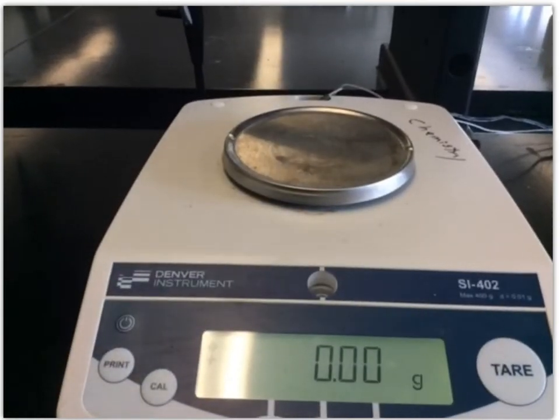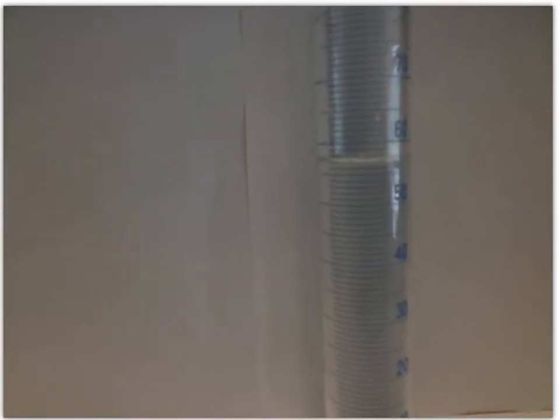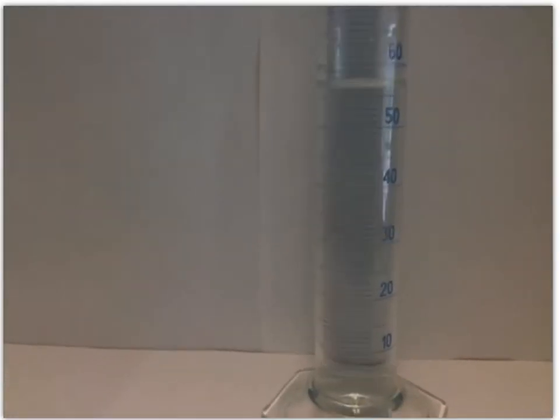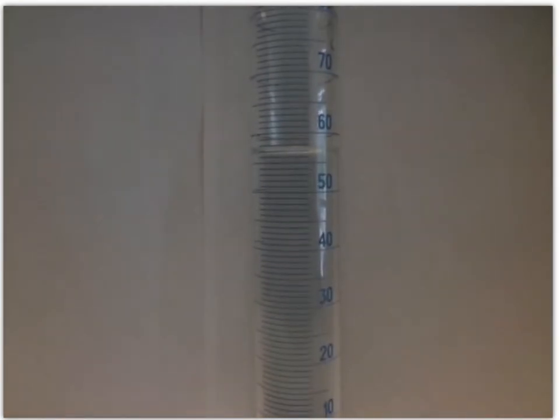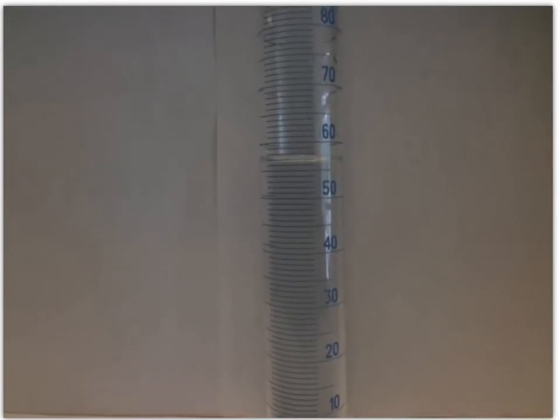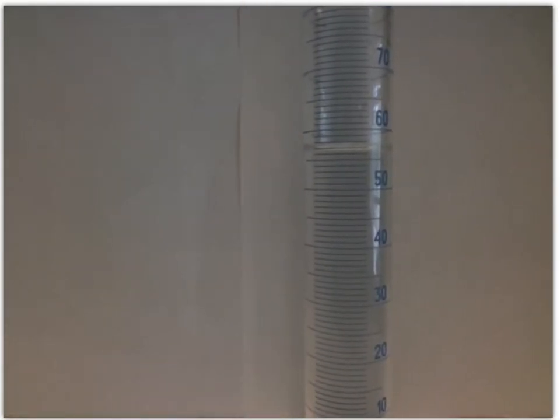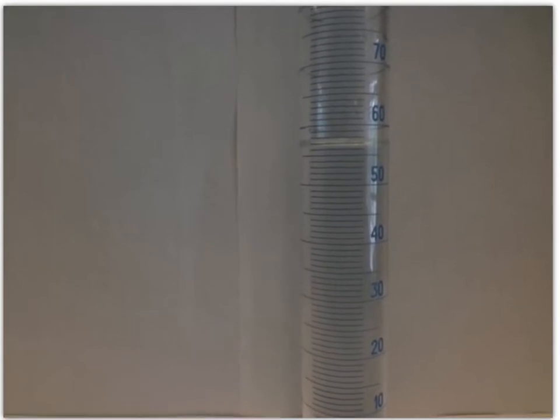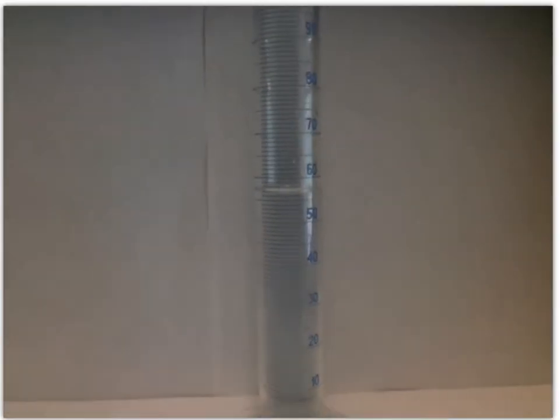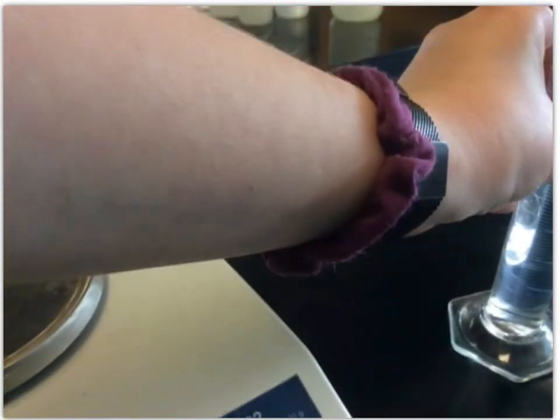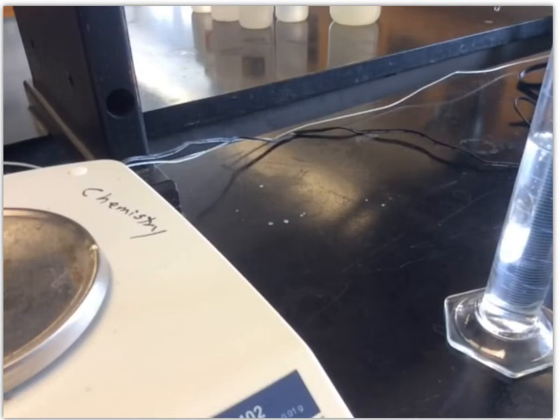Then let's see, volume. Okay, it's getting trickier to hold level here. The light's shining off of that, it's not making it easy, but it's between 56 and 57. And I'd even say it's probably close to halfway. So we will say 56.5 for our final volume for trial three, 56.5.